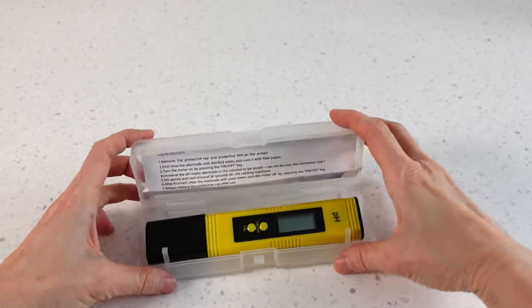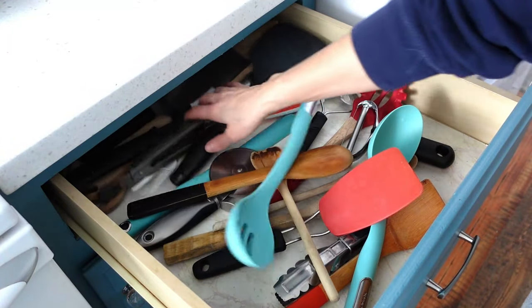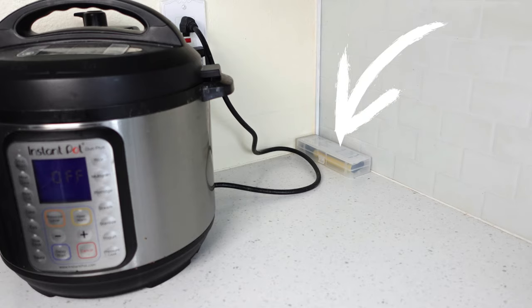To help keep the meter accurate and have a long life, here are some tips. This is lightweight and made from plastic — it can break easily. I speak from experience. Getting bumped around and jostled can disrupt its sensitive internal mechanism. It comes with a case, so keep it there anytime you're not using it. And even though it's in its case, avoid putting it in a drawer that sees a lot of action, like a utensil drawer. A low-action cupboard or countertop space is a better idea. Jostling could create the need for frequent calibration, which is just unnecessary if it's kept somewhere sedentary.